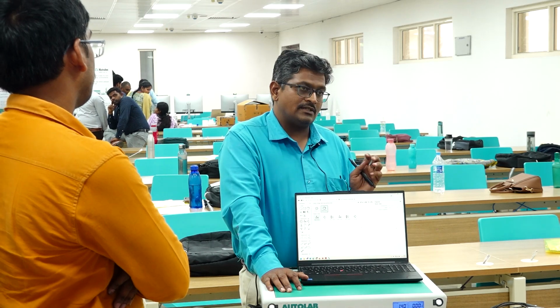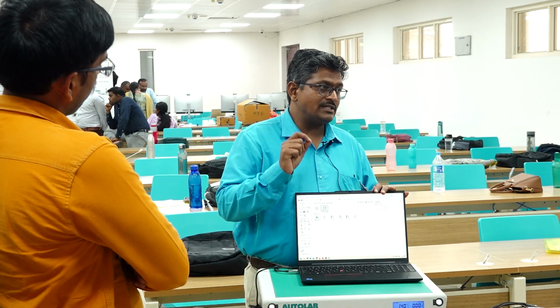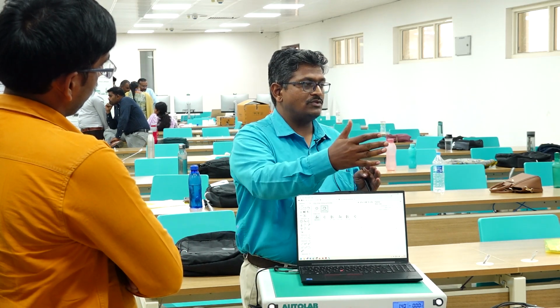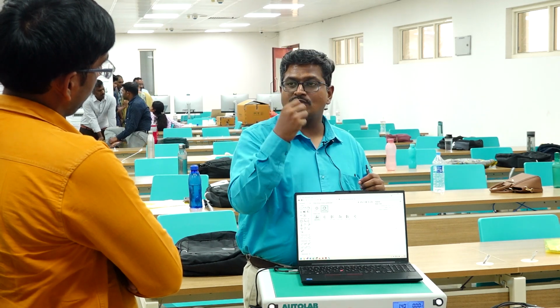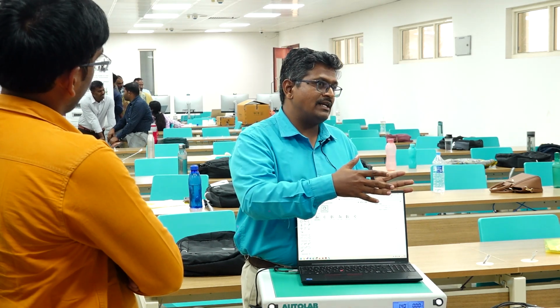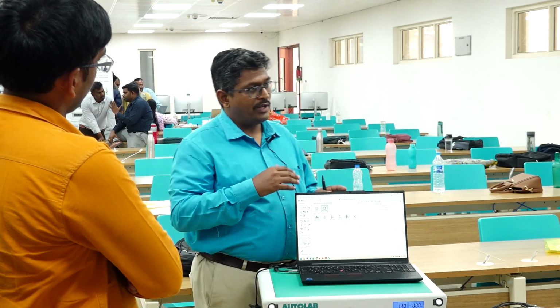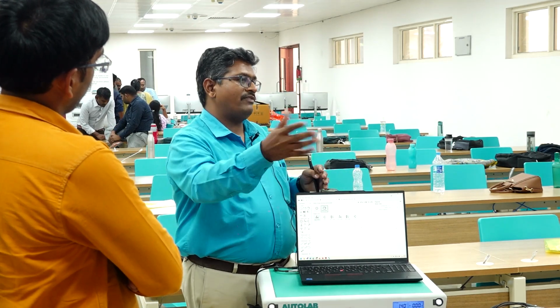We suggest you use a scheduler or a sequencer. You prepare a method with 1,000 cycles that you can repeat 10 times. Once it completes the 1,000 cycles, it saves them as one file. So even if something happens at 1050, you will have at least 1,000 cycles of data to evaluate. This way you can reduce your file size and you will not lose any of your data. And during interpretation, you can combine all the file data continuously. That option is also available.